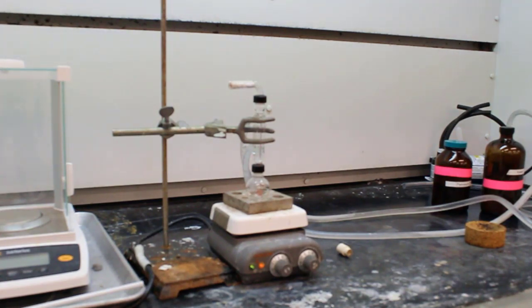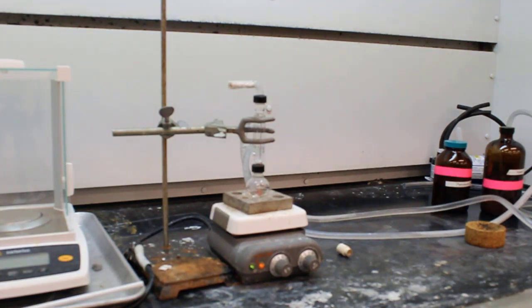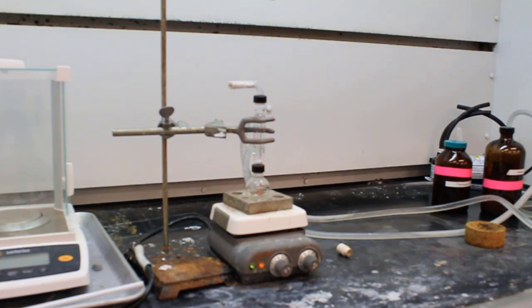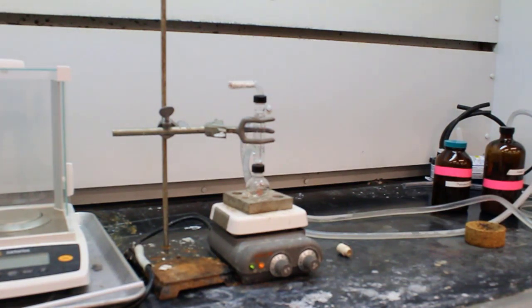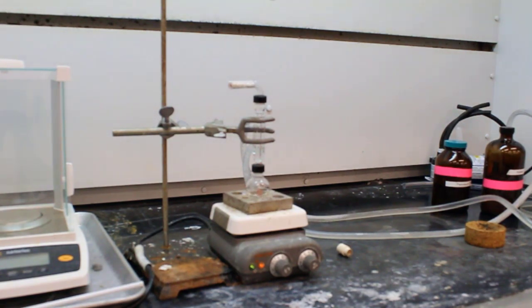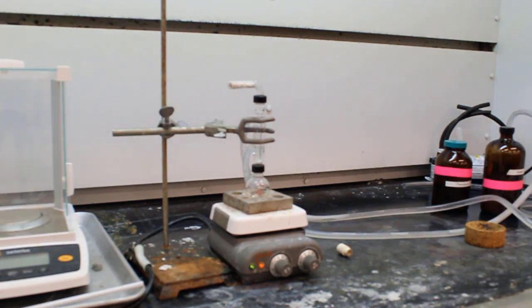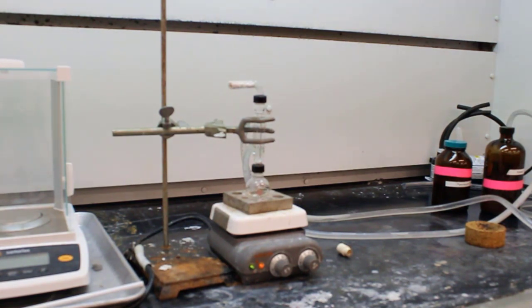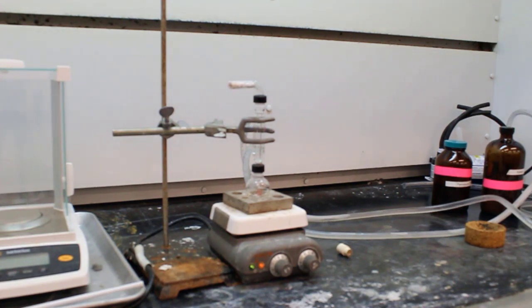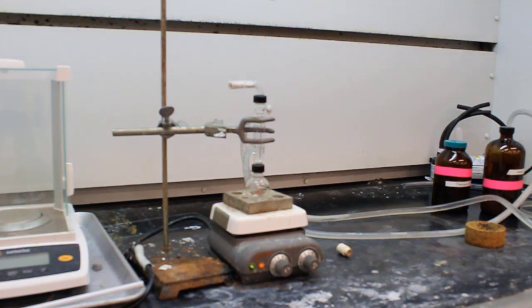This refluxing will continue for 30 minutes. The resolution may not be great enough to tell, but the solution right now is actually very clear — it looks almost like water. What you're going to notice towards the end of the reflux is that the whole solution is going to be a yellowish color. One good indication that something has happened is anytime you notice a color change, going from transparently clear to a color — with organic components, we typically see a yellowish tint.